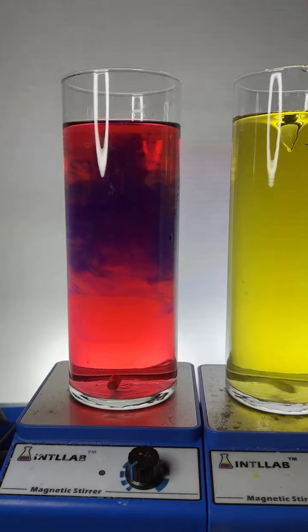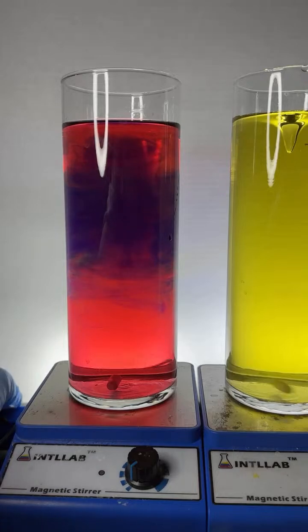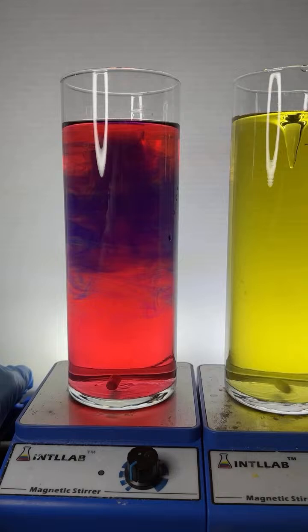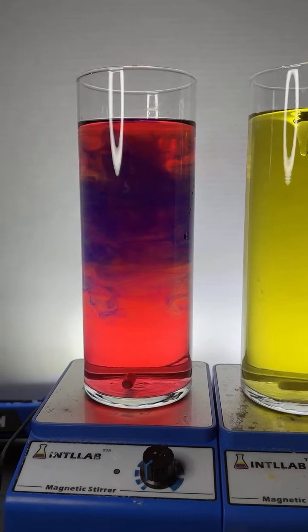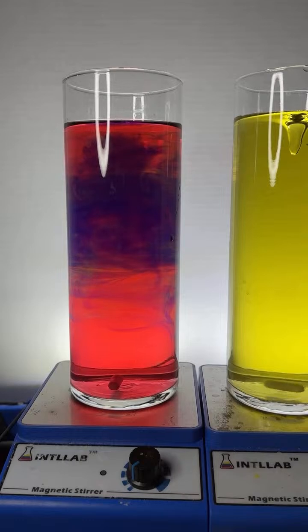Man, you guys, I'm making a mess. I got all this extra gunk around here from all the suggested experiments. I'm going to try to tilt this just a bit so we can get a little bit more light over here on this side. All right. Really pretty. Kush, can I make some of that? I'm not going to mess with that.